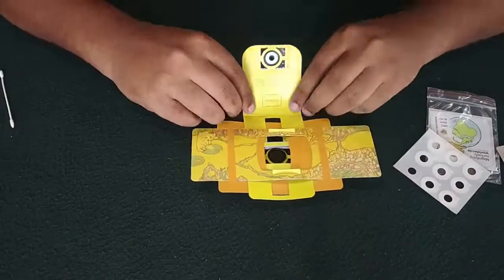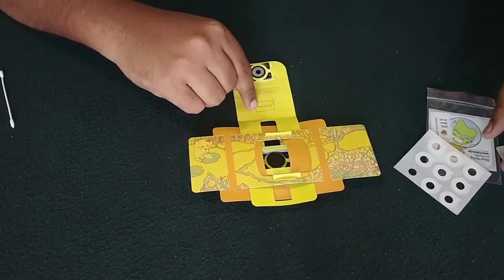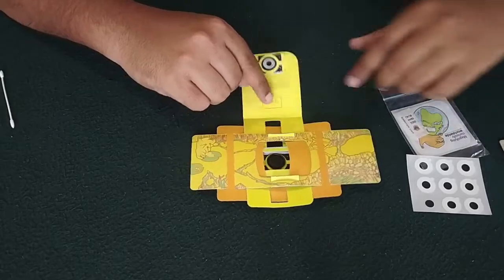Now the last part. Here we have an ID sticker which is present over here. We can attach it.